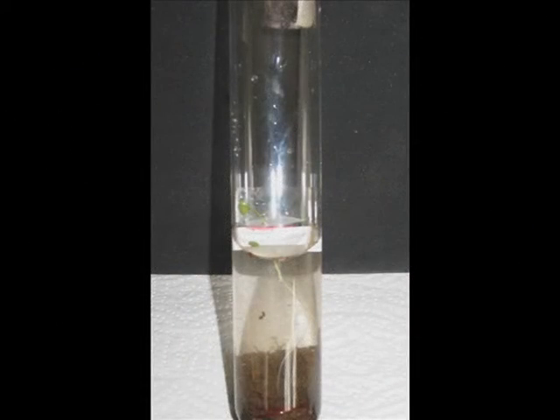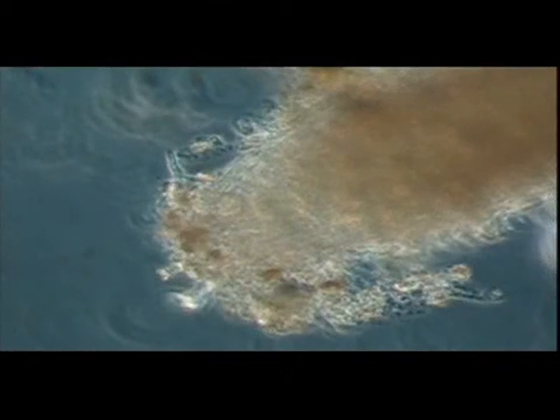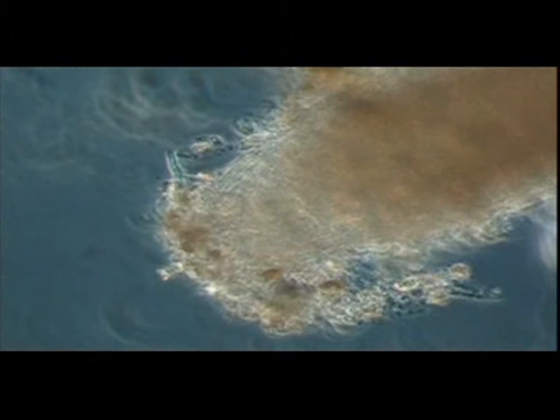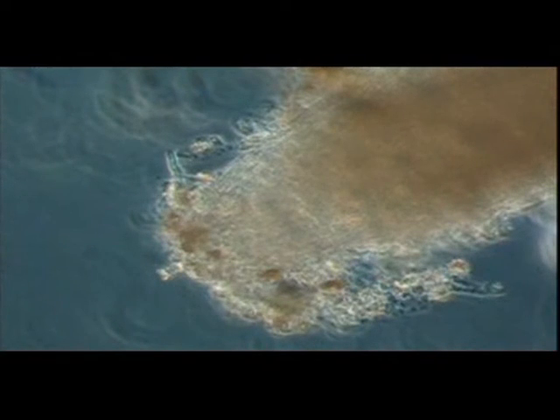Here you can see one of these boiling tubes with a microscope slide and plant seedlings on top of the soil sample. This is a root apex of a white clover seedling, and you can see large numbers of flagellates moving around the root cap cells. Later, at greater magnification, you will see a Limax soil amoeba moving along the surface of the root cap cells before finally moving in amongst the root cap cells themselves. Clearly, the root apices are centers of intense protozoan activity.